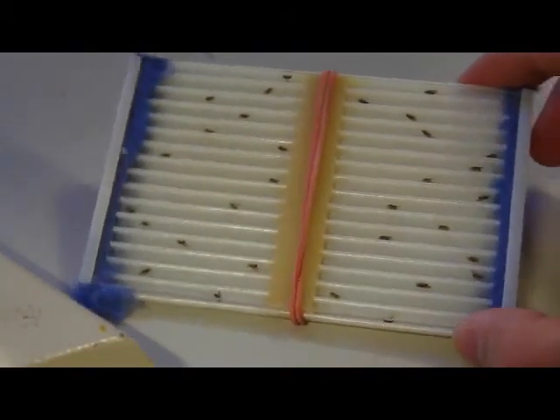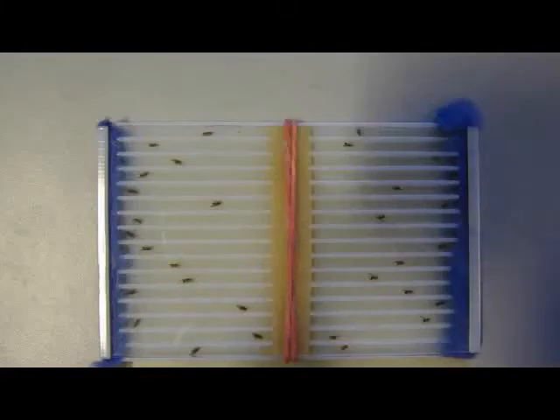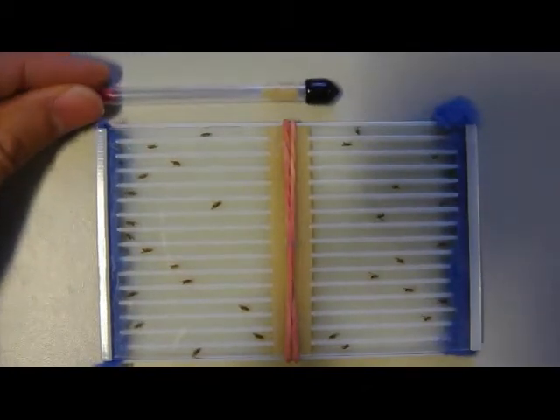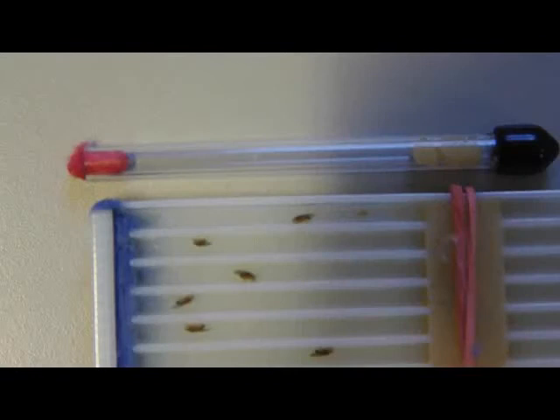When you're done, use some tape or an elastic ribbon to make sure the cover will fully adhere and seal the grooves. The arena was designed so that the single flies will have the same space that they would have in a glass tube.